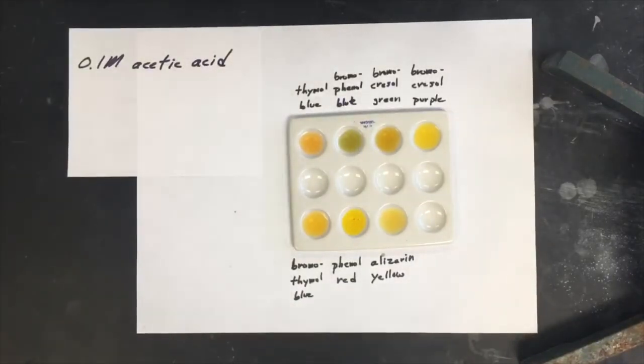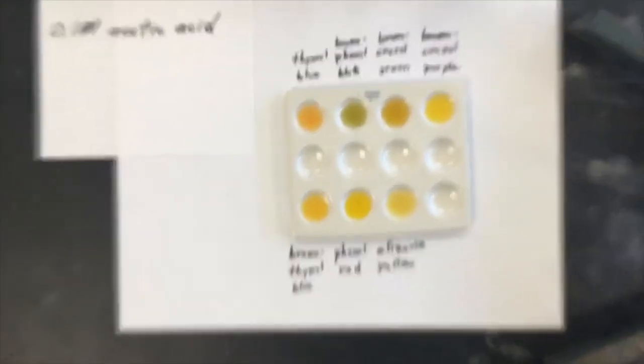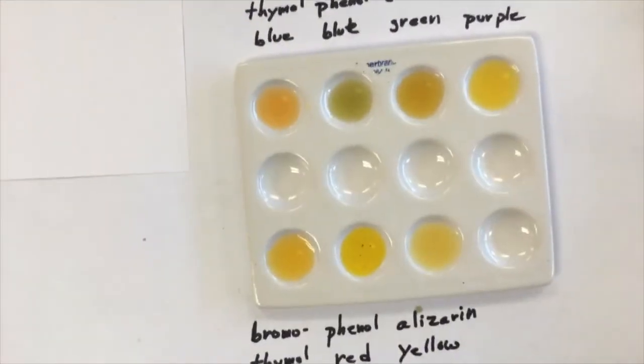Here's the next solution. It's 0.1 molar acetic acid. And we got different, slightly different colors than we did on the last one. So let me zoom in and you can get a better picture of what's going on.